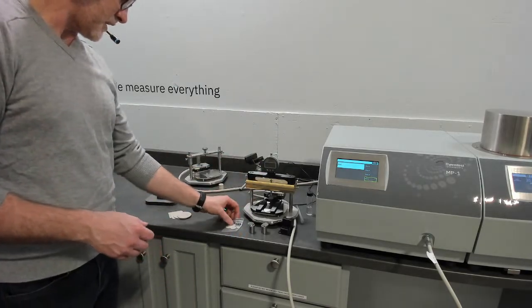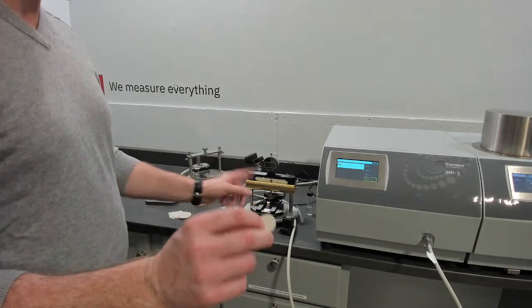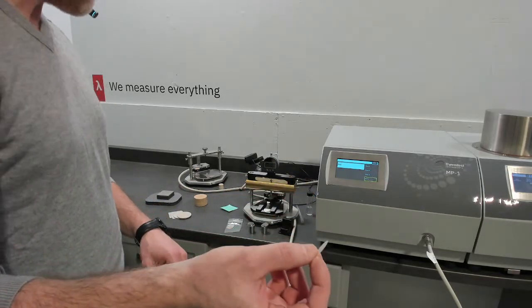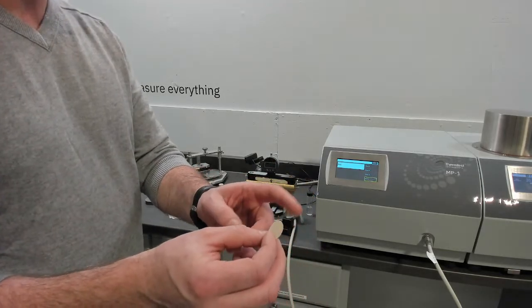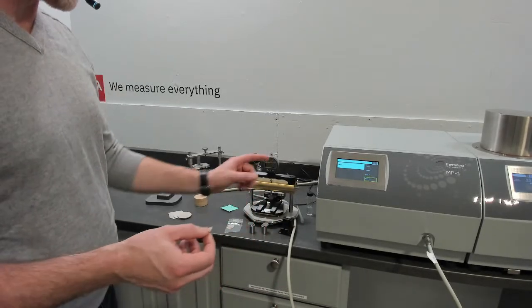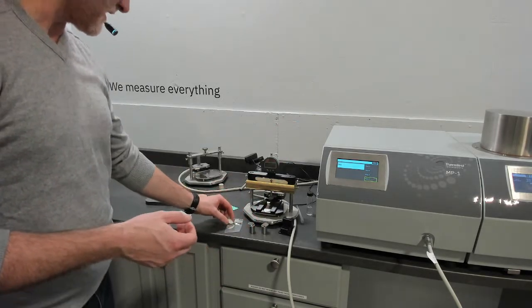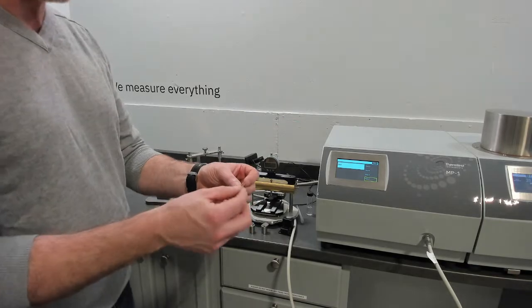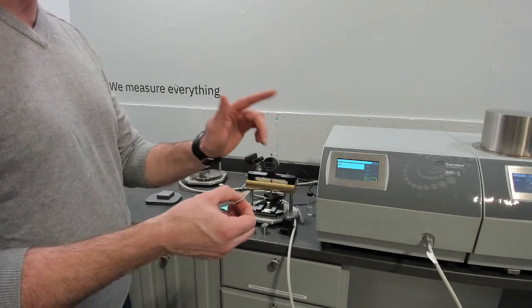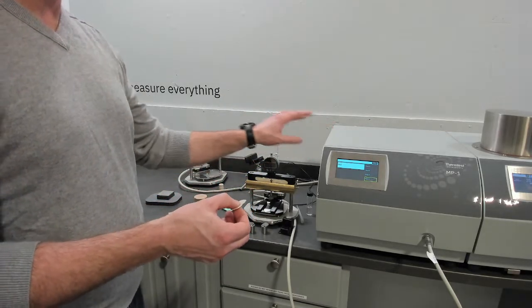The other option for measuring very thin materials is our thin film module. So this is essentially the same thin film, a little thinner, 0.25 millimeters thick. We can measure the intrinsic properties of that with our thermal resistance thin film method that's available on the MP-1. So this method allows you to measure 1, 2, and 3 layers and draw a straight line through the change in thermal resistance. Again, this is a method of measuring thermal resistance with a transient method, so it's very unique.